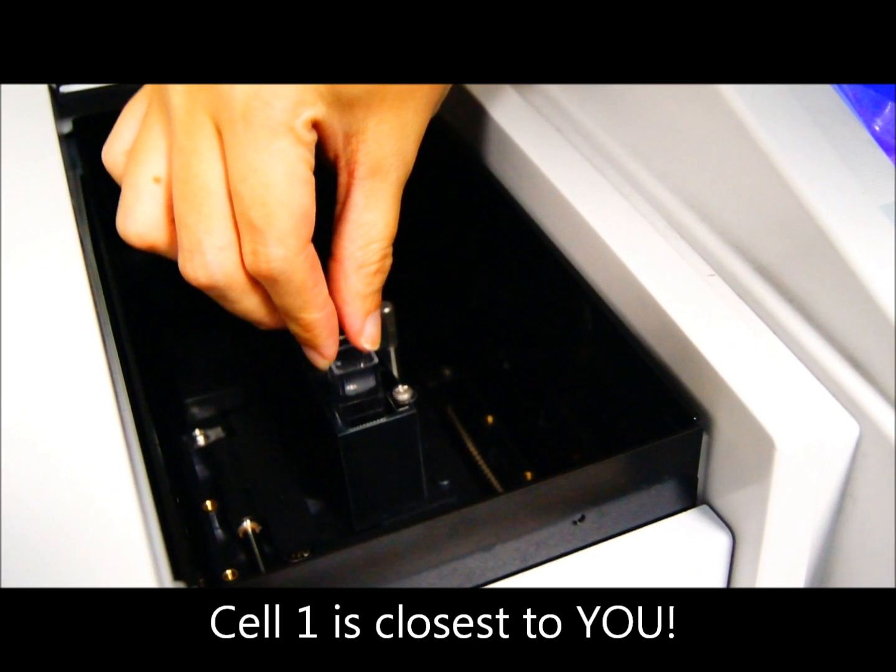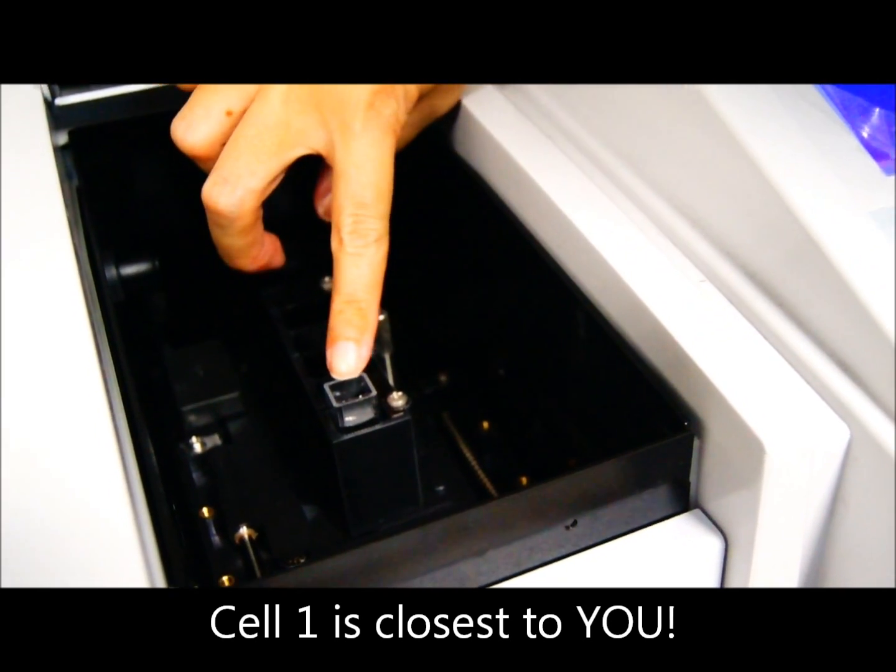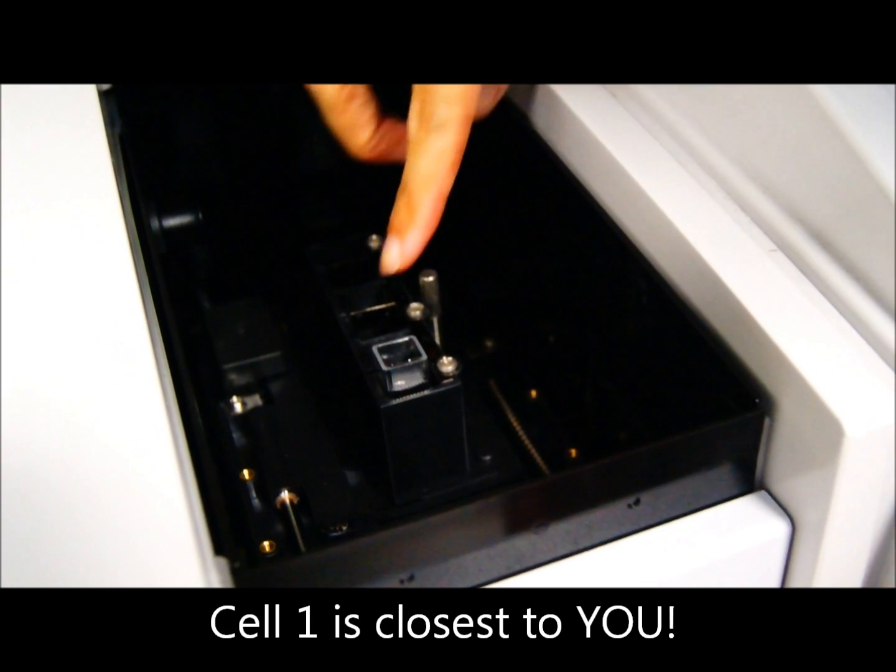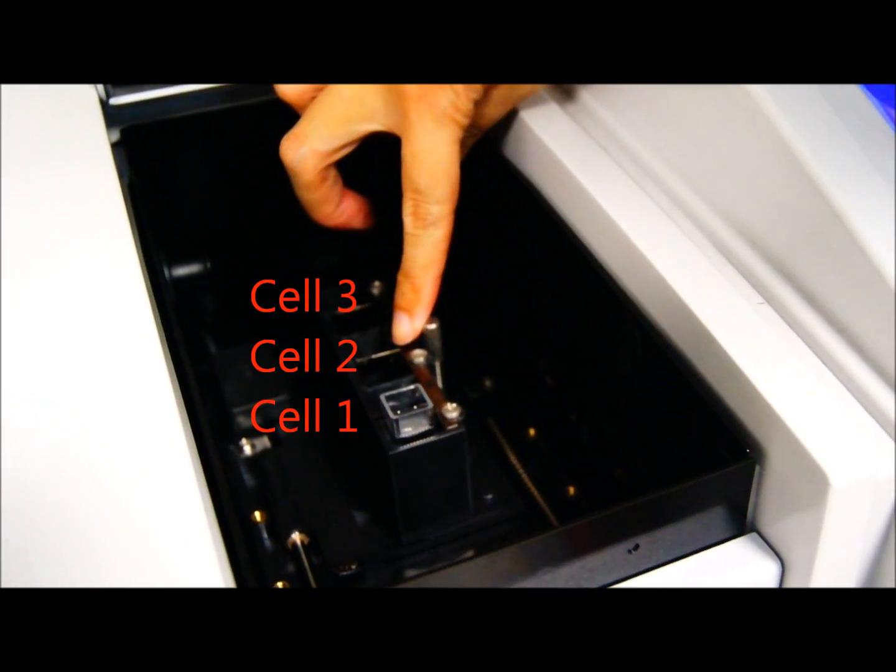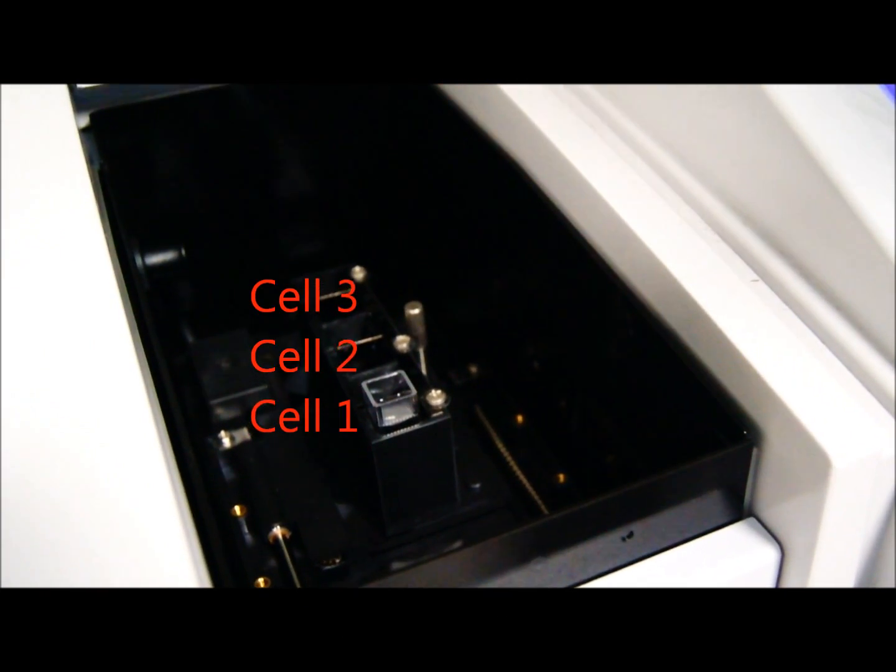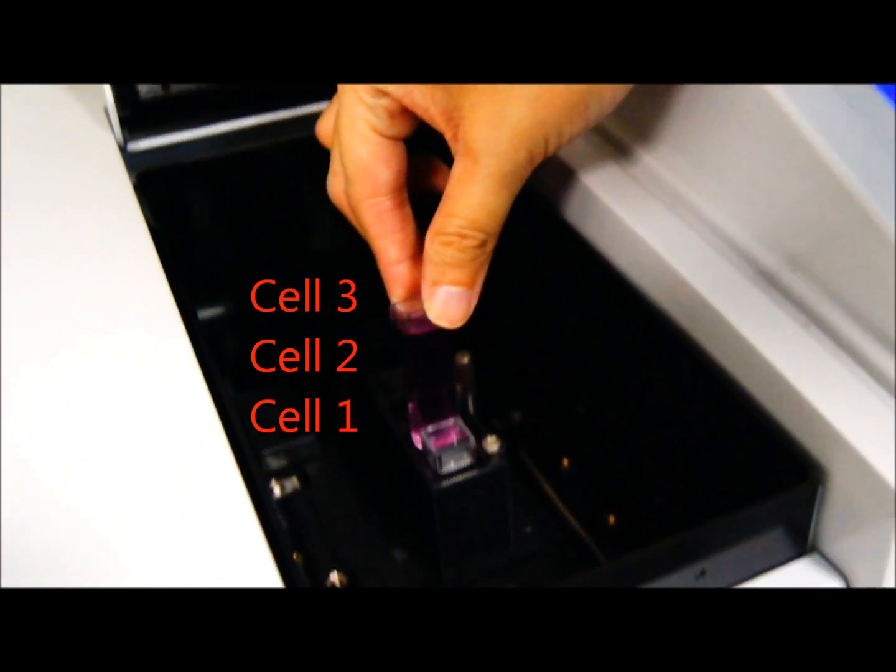So how we put it in, this position is actually cell 1. Closest to you would be cell 1, and then 2, and then 3. So now I'm putting in cuvettes 2 and 3 in that order.